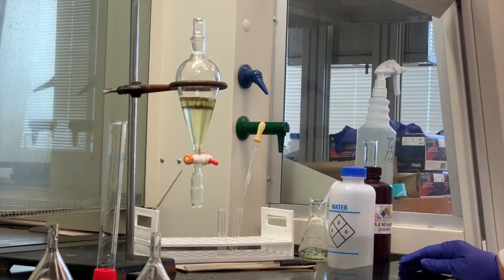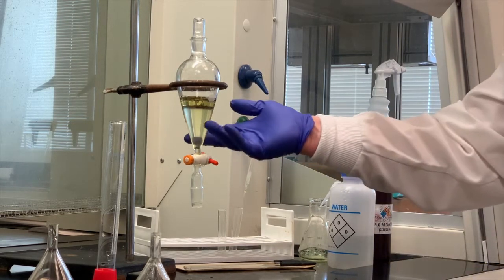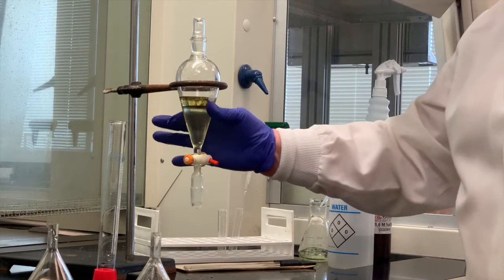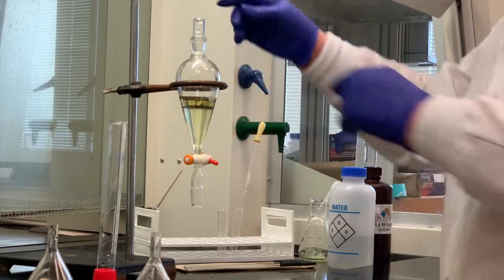When you are doing an acid-base extraction, this is a chemical reaction between these different substances, so you do want to mix them very thoroughly, shake them up well. Sometimes you can tell when the reaction is complete if you're hearing very little of any gas or pressure coming out. And it looks like the bottom layer, which is organic, is lighter than it was before. Again, if this was the organic, the first wash, the second wash is going to be the organic now.